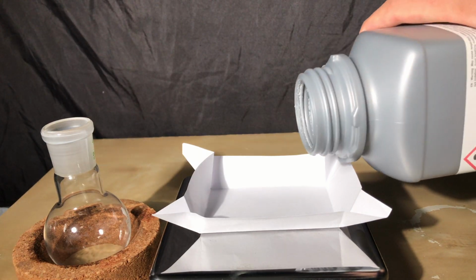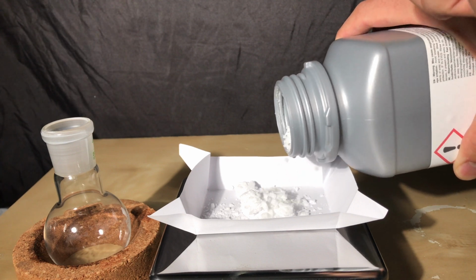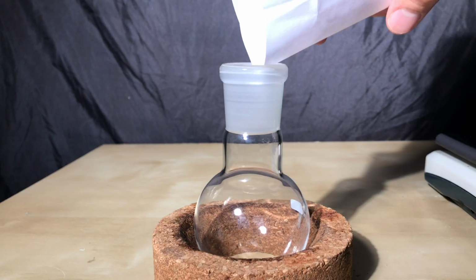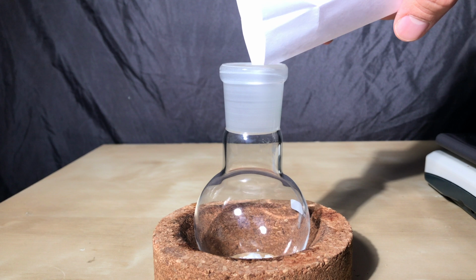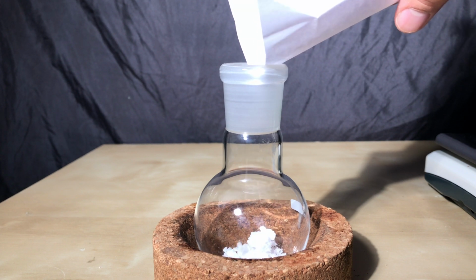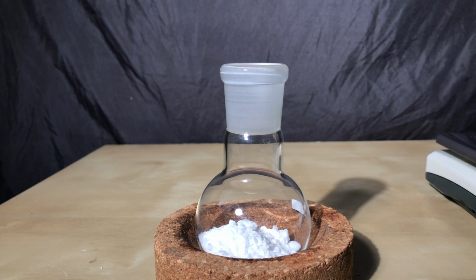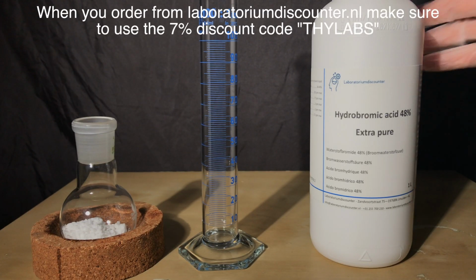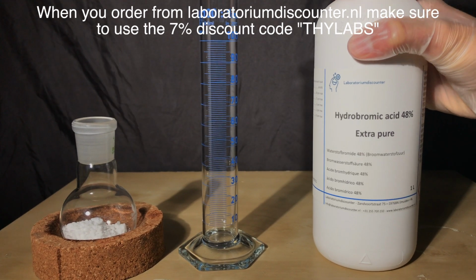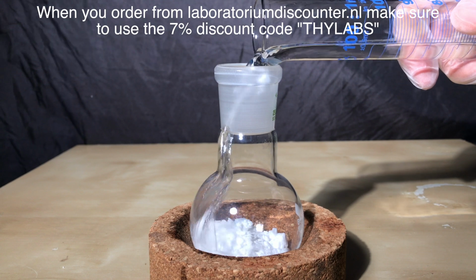I started off by weighing out the benzhydrol, which will be reacted with a massive excess, 300% excess to be precise, of hydrobromic acid to make diphenylbromomethane. It was added to a small round bottom flask, followed by the most important ingredient, which was a stir fish. I measured out the hydrobromic acid, added it to the benzhydrol, stoppered the flask and let the mixture stand overnight because I didn't have time to continue today.